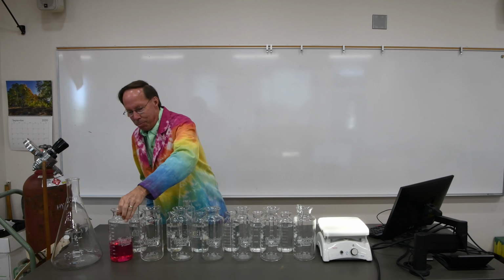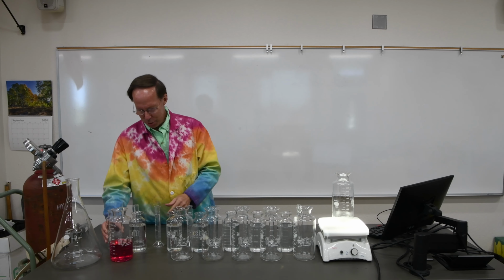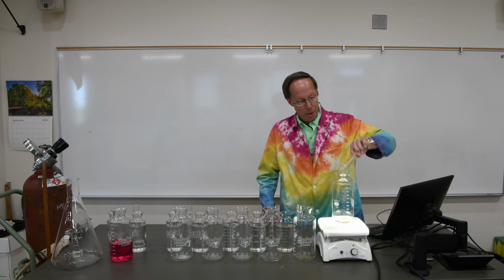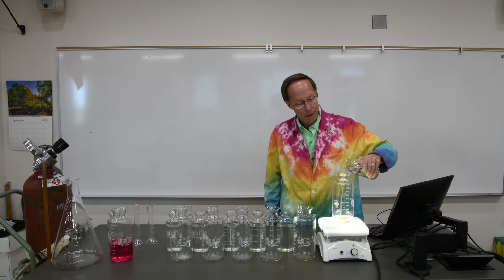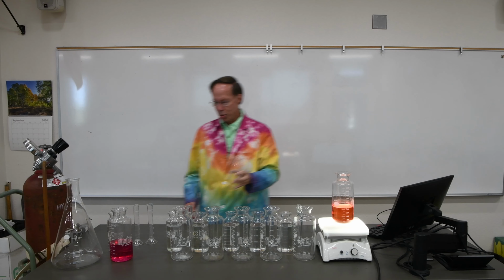Now let's take our second beaker. What color do you think we're going to get here? At this point, when the kids are guessing, they're still all over the map. But you guys, being chemistry students, may be able to figure this out a bit more quickly. We'll add some of our first chemical here again. So let's see what color this second one becomes. Ooh, that's very pretty. That looks like a lovely orange color.